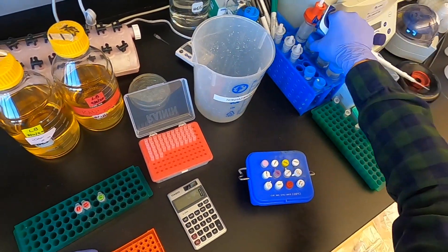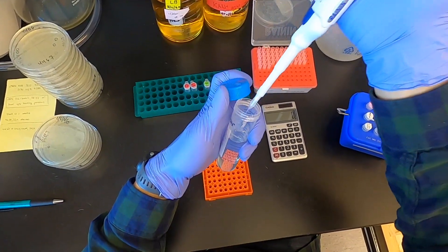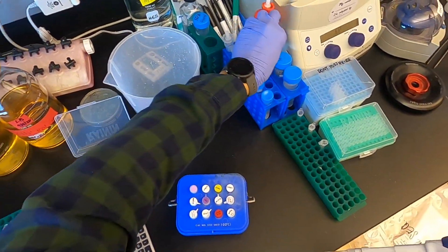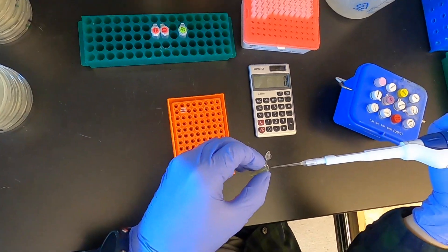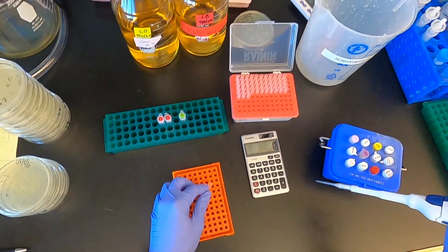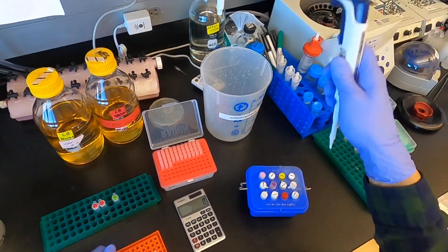Now typically I'll be doing a lot more than just one Golden Gate assembly at a time, in which case it makes a lot more sense for you to prepare a master mix of whatever it is that you're making, based on the component plasmids and enzymes.